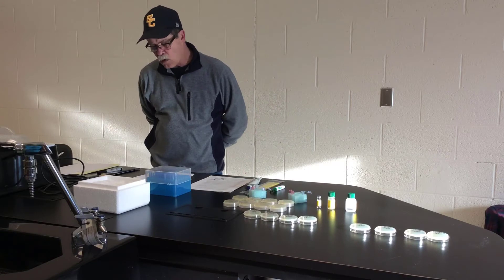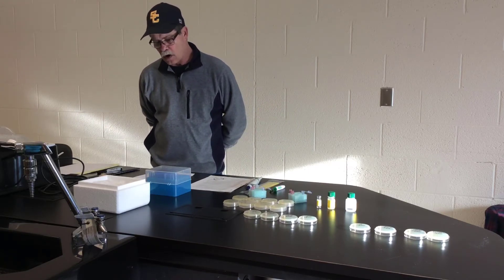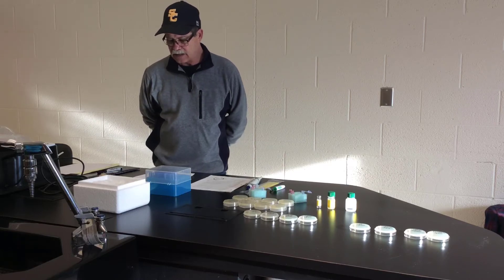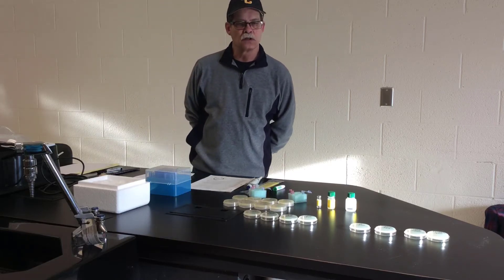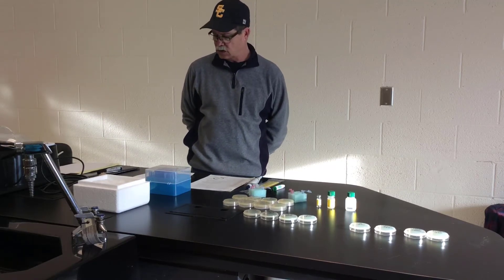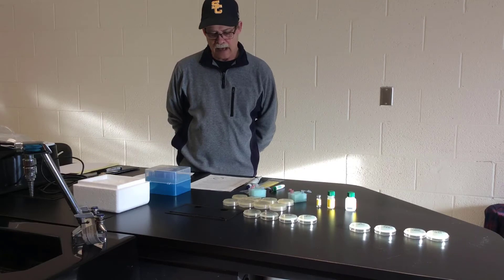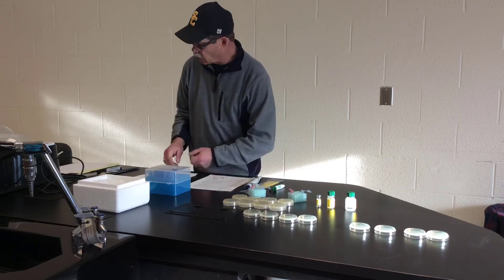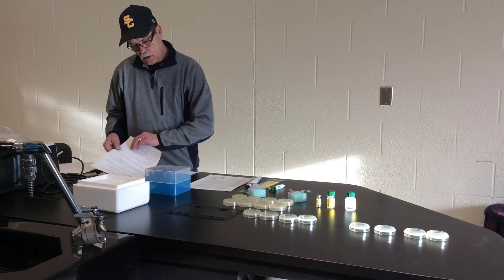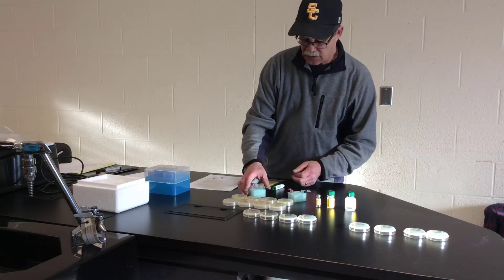So now we're going to perform the transformation procedure itself. Tomorrow, or Friday, I will take pictures of the results and have those posted so that you can complete this lab. Let's move on to the procedure — we have everything in front of us here.